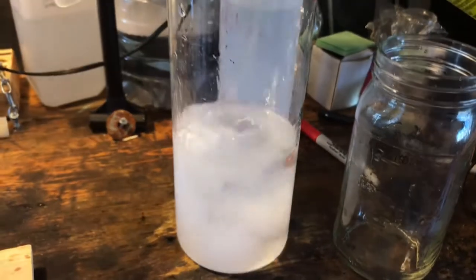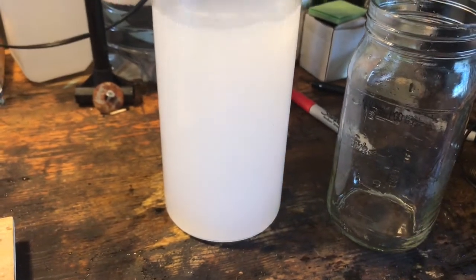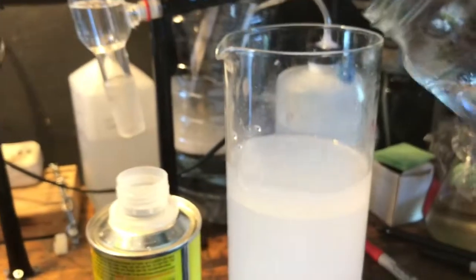I'm adding it to an equal amount of water, and you can see the xylene's crashing out immediately. This is because xylene is insoluble in water and also not miscible. However, acetone is, so by adding it to an equal amount of water, we can separate them.